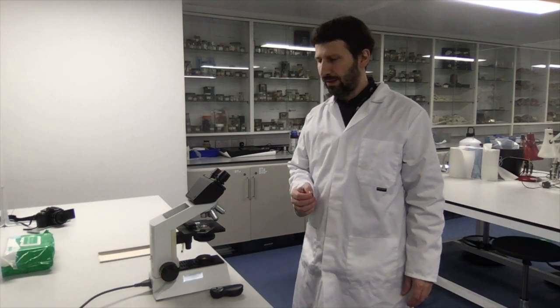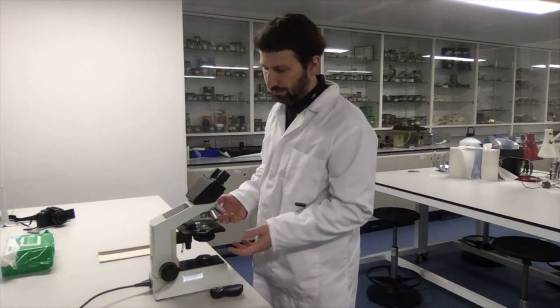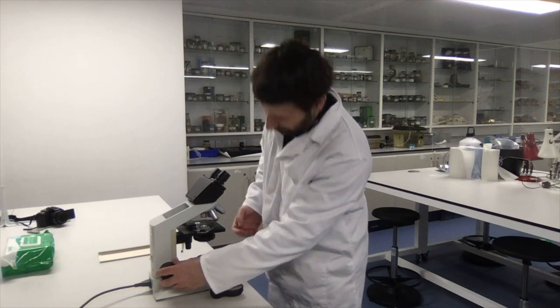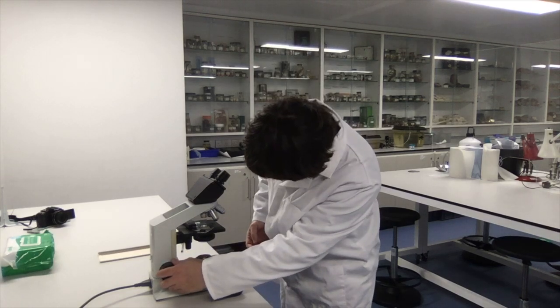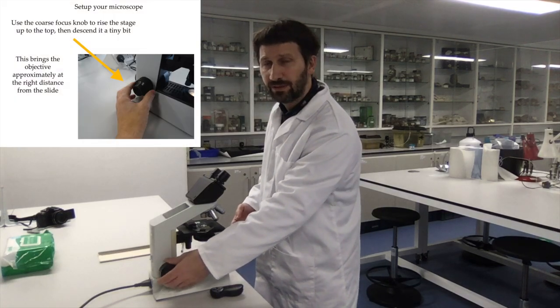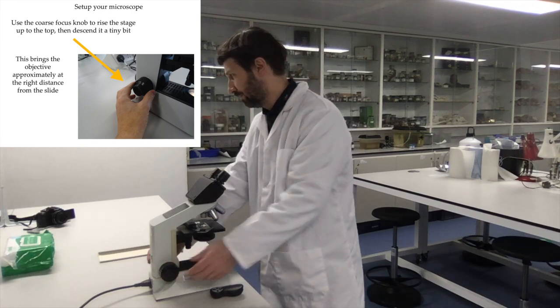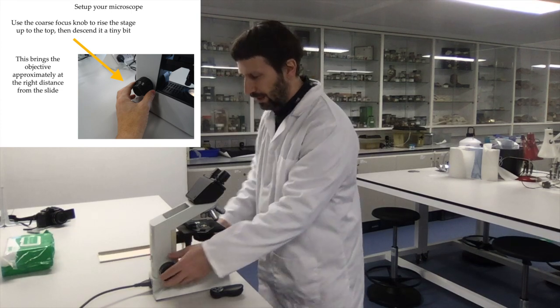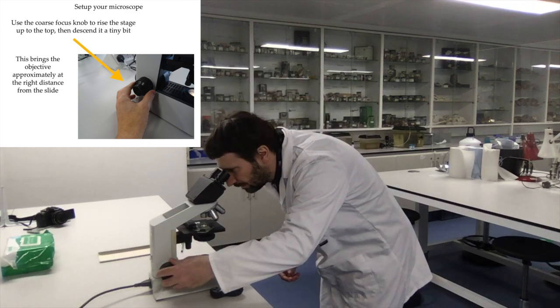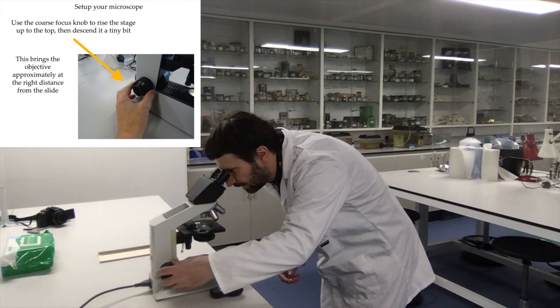One thing to check is that the image is in focus. By chance it was almost in focus, but otherwise it is good practice to start by bringing the stage up to the top using the knob on this side, and then lower it little by little until you see your specimen.